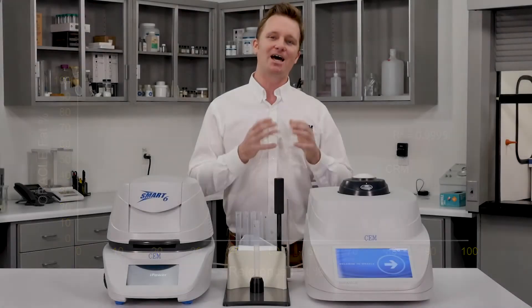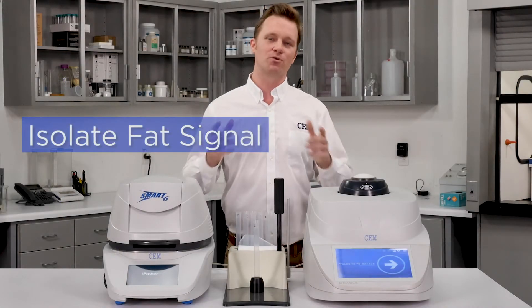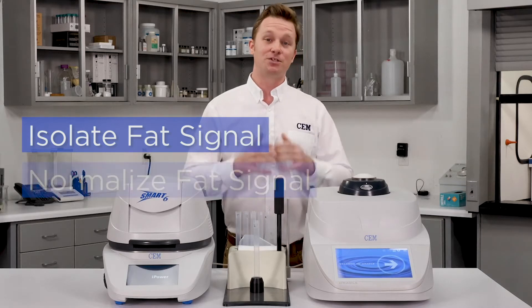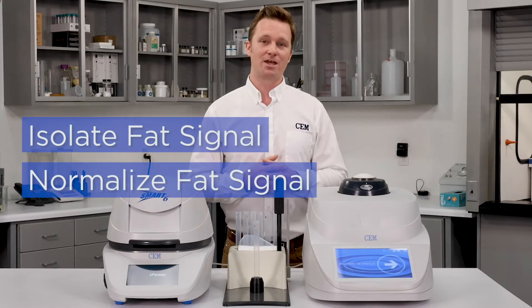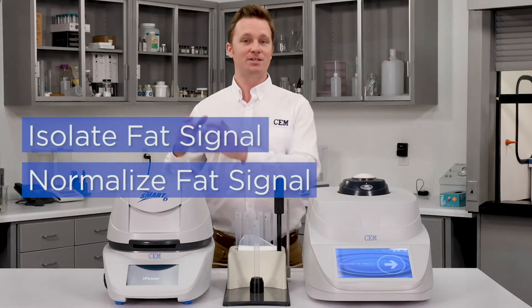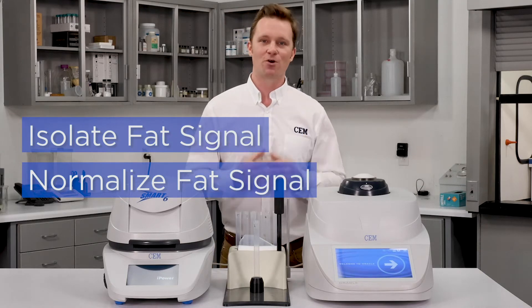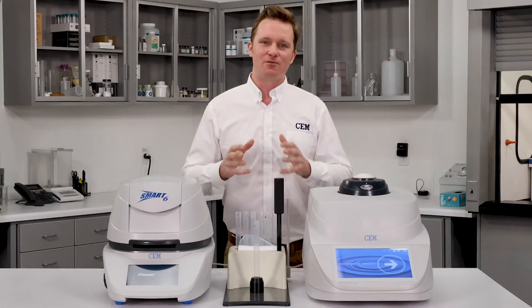That's enabled by two major breakthroughs. The first is that we're able to isolate the fat signal from all other components, removing any interference from the measurement. The second is that we're able to normalize the fat signal, so regardless of whether the sample is plant-based, animal-based, or even synthetic-based fat, we get the same uniform response.